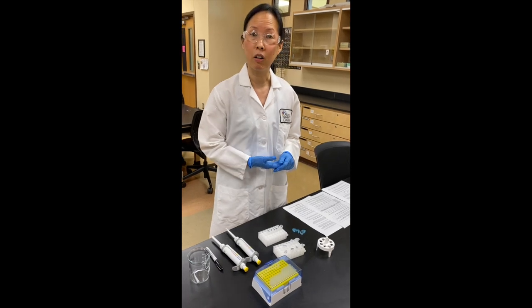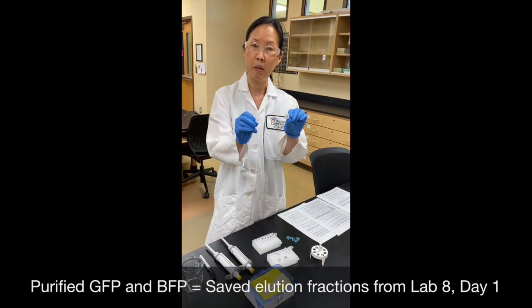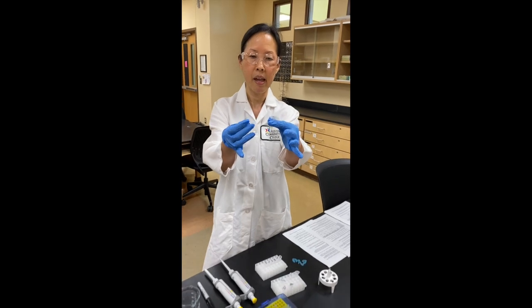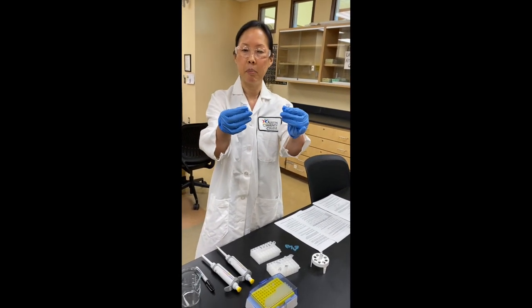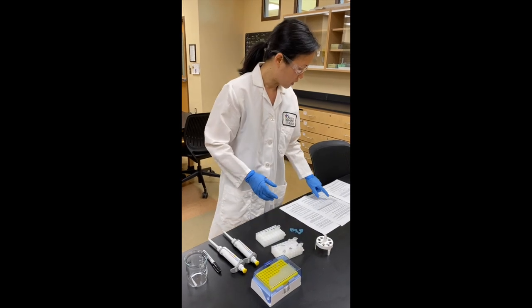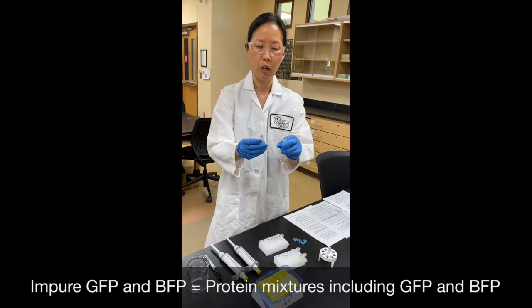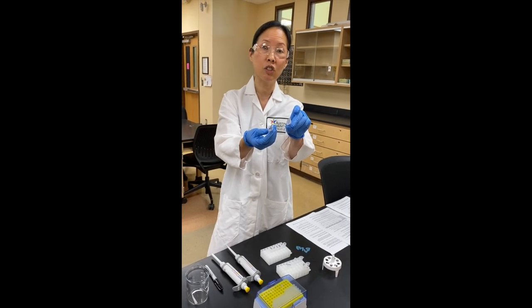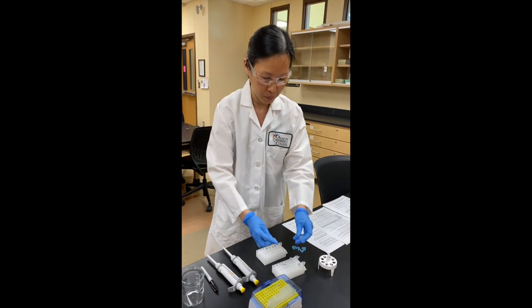The first two ingredients are called Purified GFP and Purified BFP — the GFP and BFP elution fractions that you should have saved from last week's lab. The GFP one should contain the most GFP, and the BFP one should contain the most BFP. The next two possible ingredients are called Impure GFP and Impure BFP — they represent the original protein mixtures you isolated the GFP and BFP from, containing proteins larger and smaller than GFP and BFP.